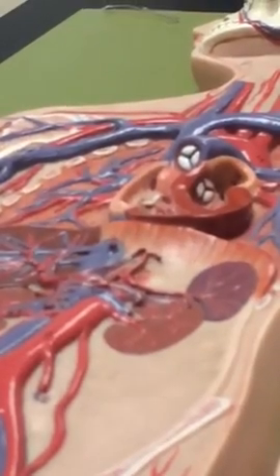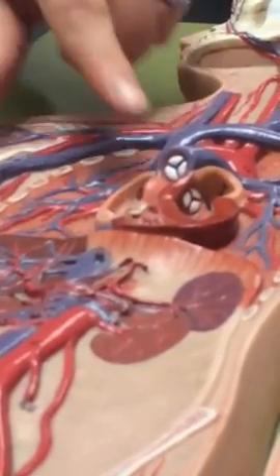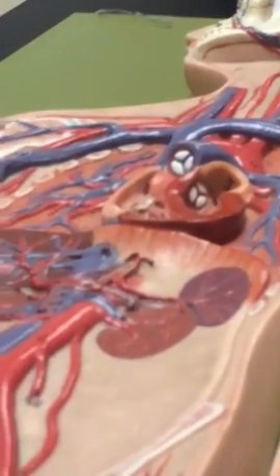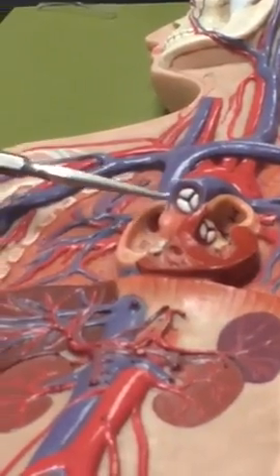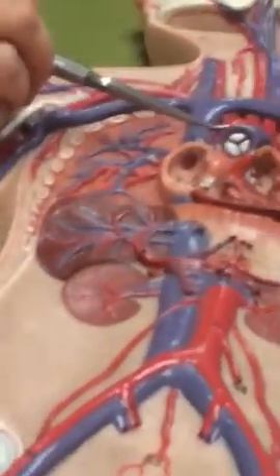Okay. Aortic semilunar valve. Looks just like the pulmonary, tucked up under here, giving rise to the aorta. And then the aorta. I just showed it. Oh, so I need the parts. Ascending aorta is this little piece that goes straight up. And then the aortic arch.